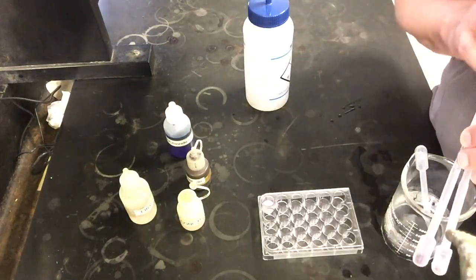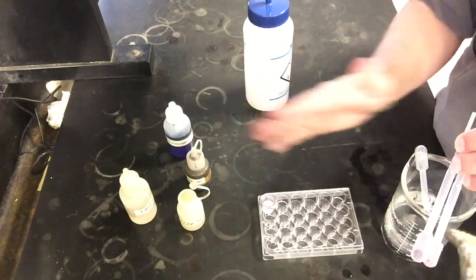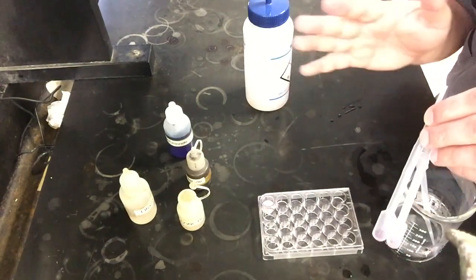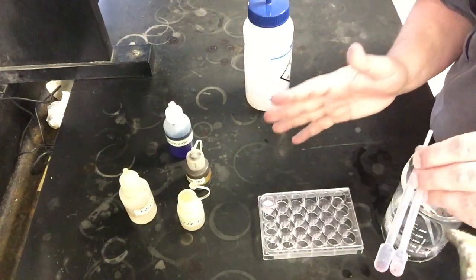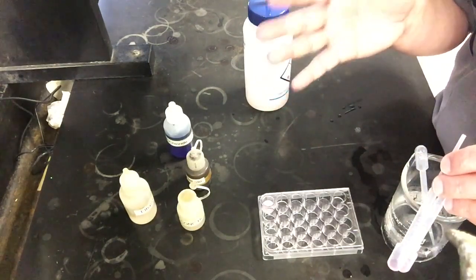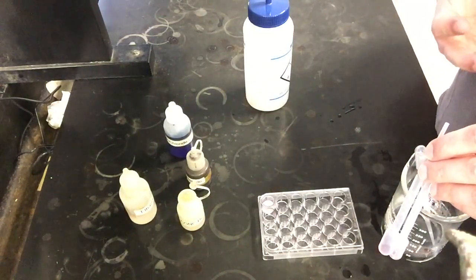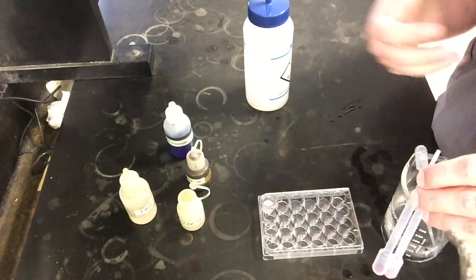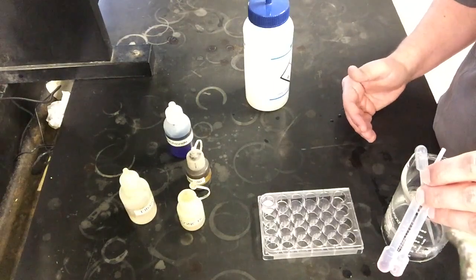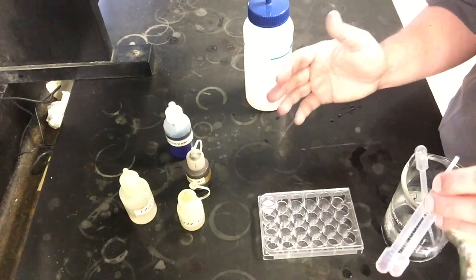The rest is really going through and understanding why some of these changes are happening. Hopefully you should be able to make sense of each of these visual color changes and all of the reactions that we've seen today and figure out, okay, why did it make that change? Always be asking that question, because Le Chatelier's principle is usually relatively straightforward. If you make a particular change to an equilibrium, you should see a particular reaction from that equilibrium to get back to an equilibrium state when you've disturbed it. Things like adding a reactant should always push it towards the product side. Adding a product should always shift it towards the reactant side. Things like that should always be true for any reaction.